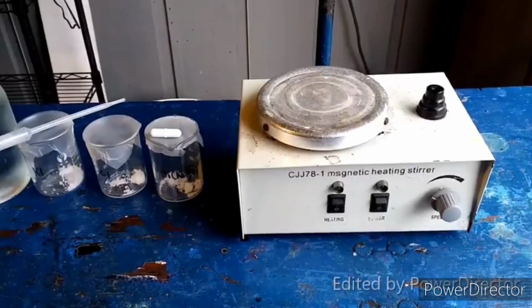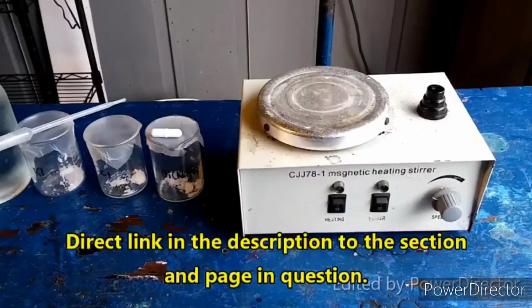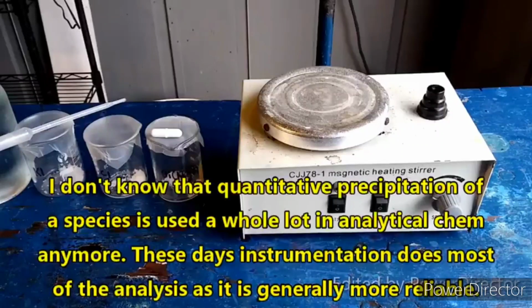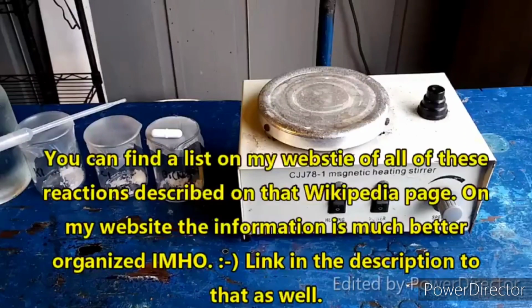If you look at that article, you'll find there's a section labeled analytical chemistry. Apparently, and I don't know if this is still used a lot anymore, one technique in analytical chemistry was to react various metal cations with cesium chloride and usually a couple of other reagents, and see if you got a precipitate or not.